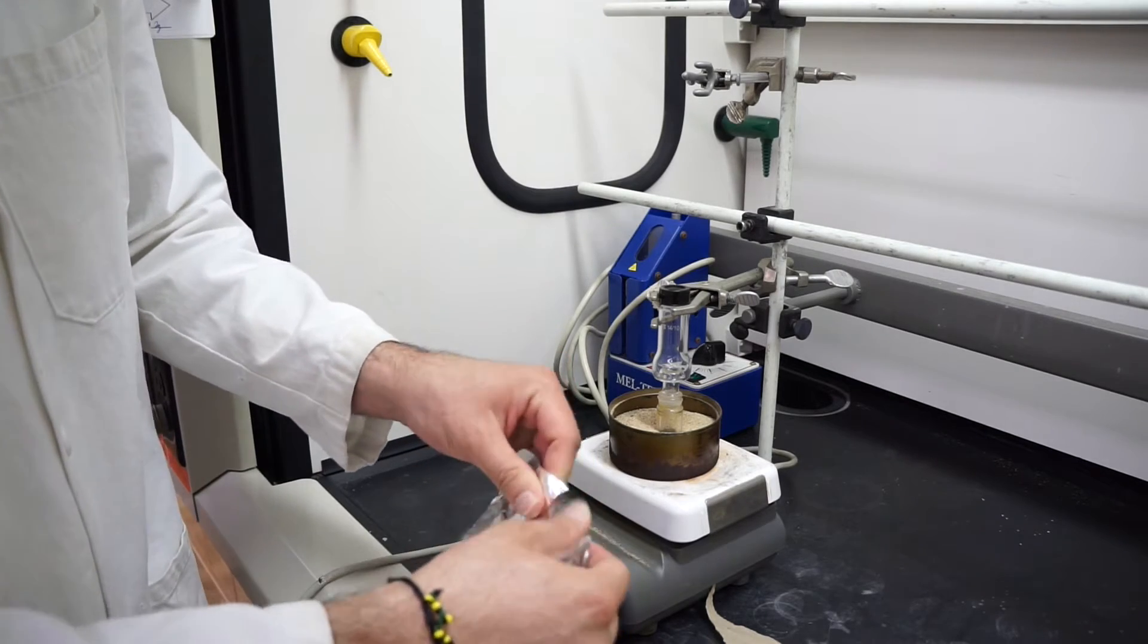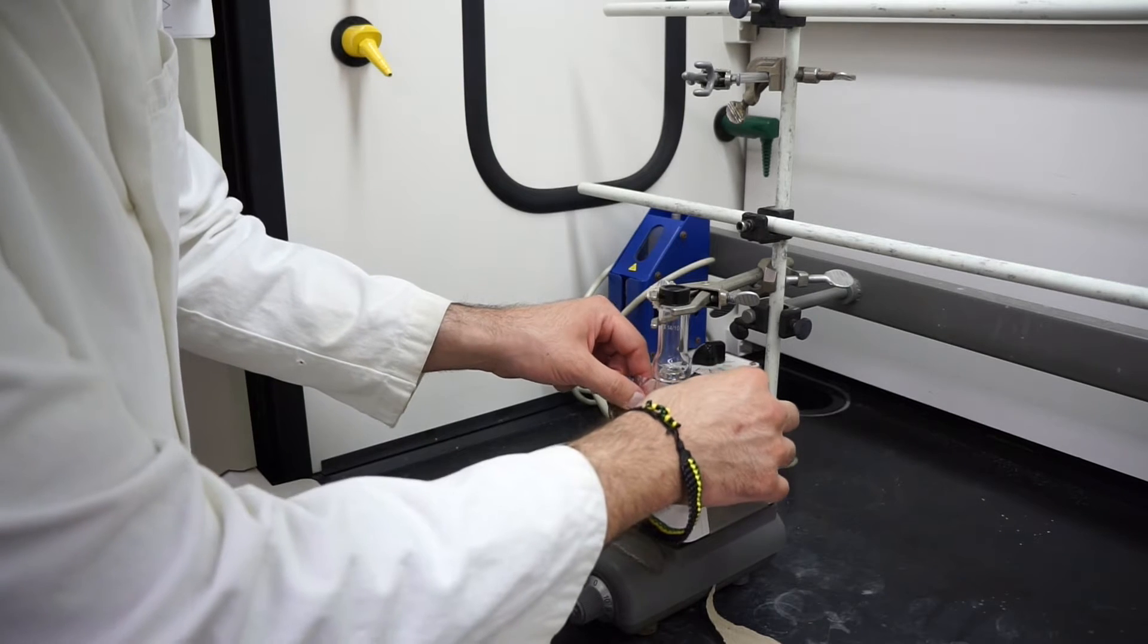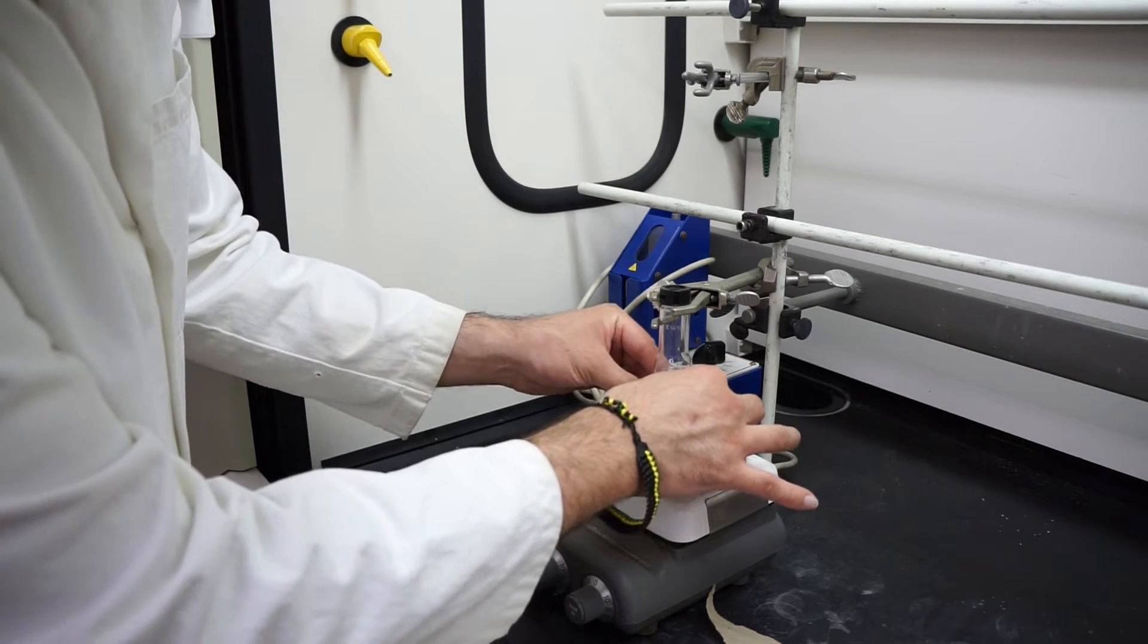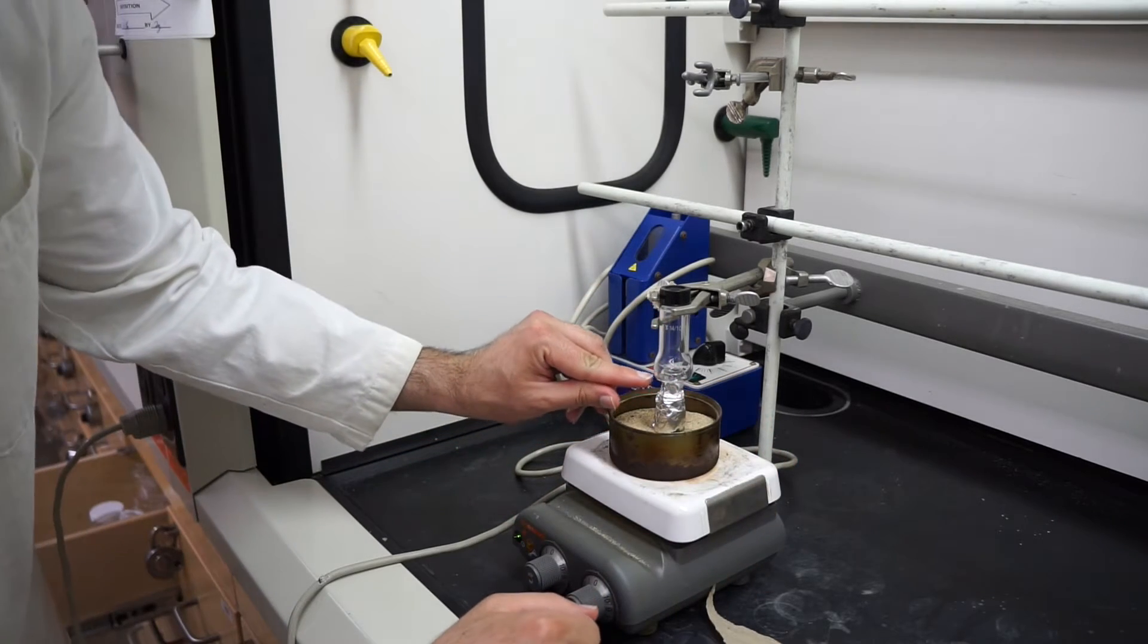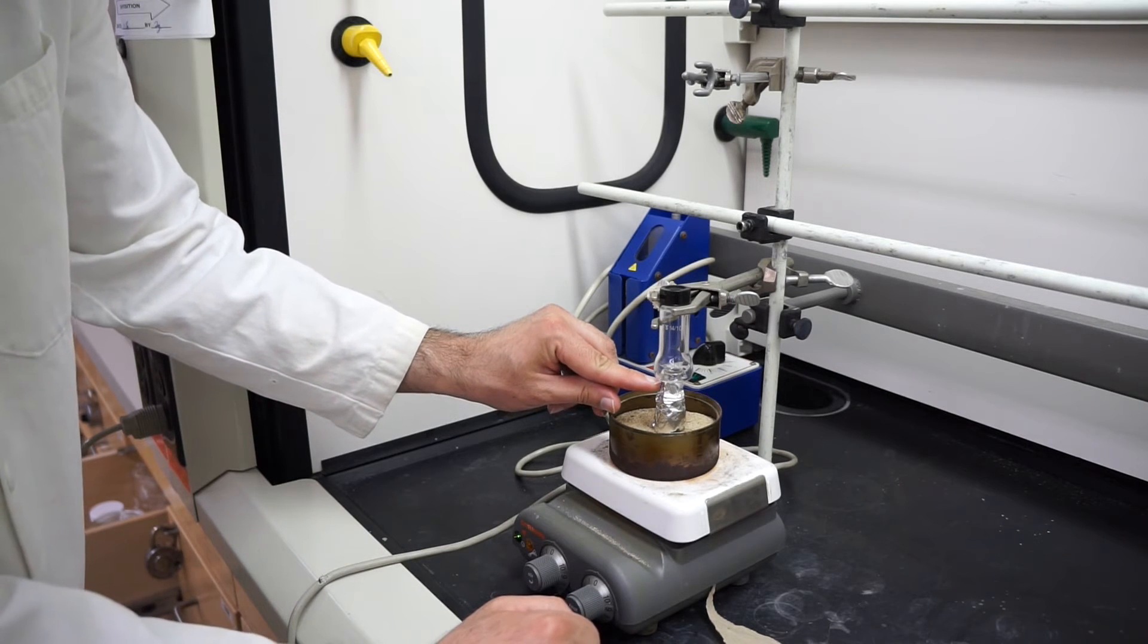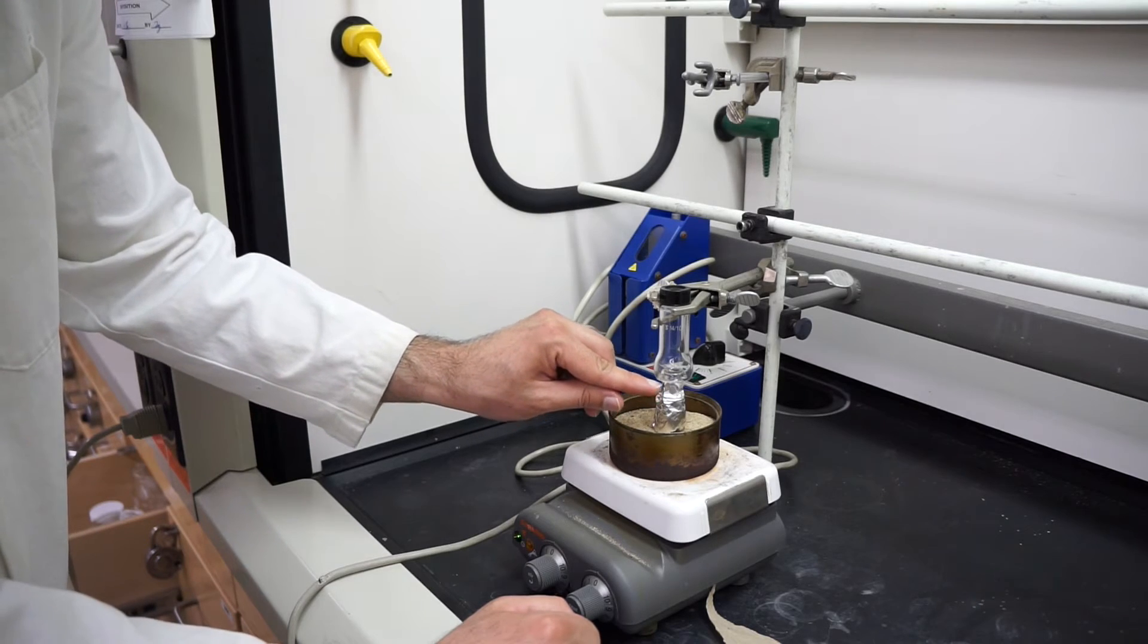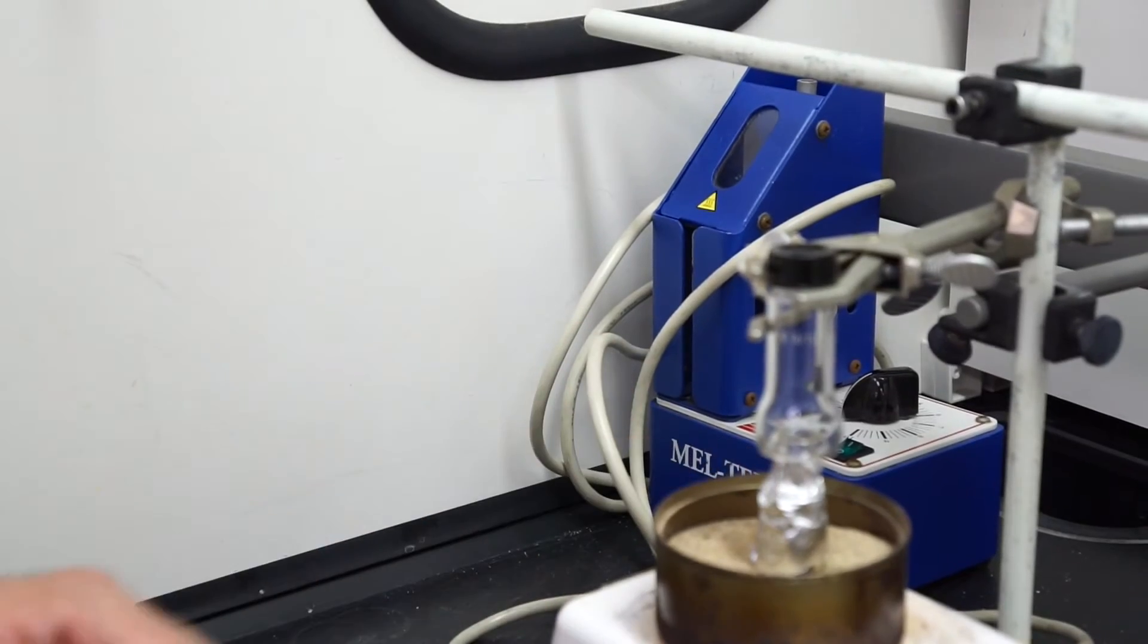We'll take our aluminum foil and I'm going to rip it a little bit. I'm going to give the conical vial a nice aluminum coat. Notice that the aluminum isn't covering the bulge, that's the bulge where the moat's going to be. We're going to cover the neck between the two pieces to make sure condensation doesn't get stuck in there.